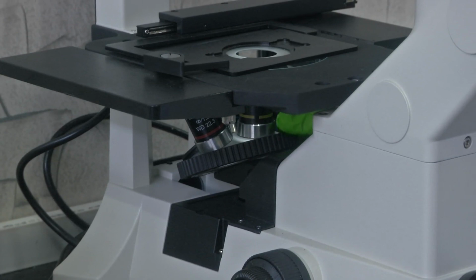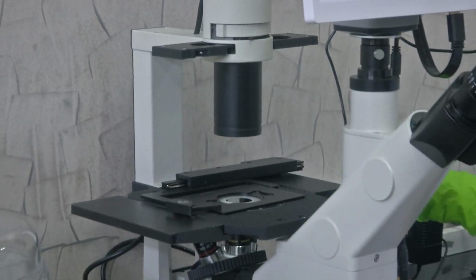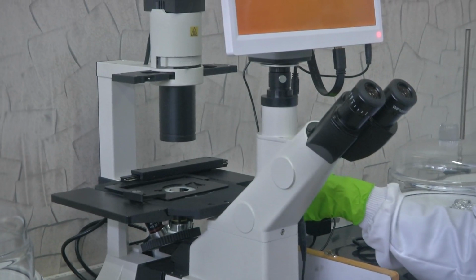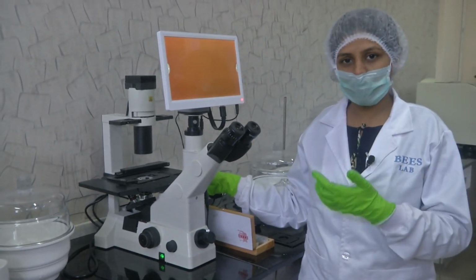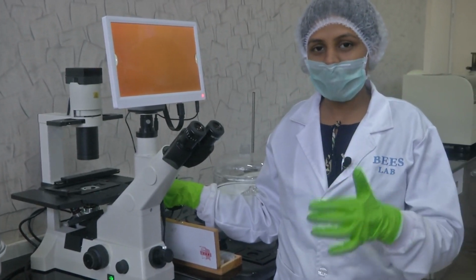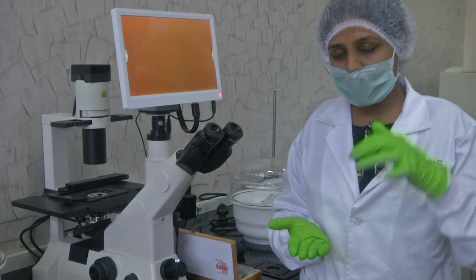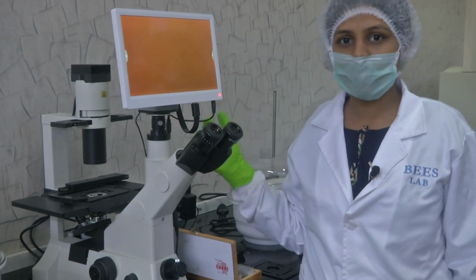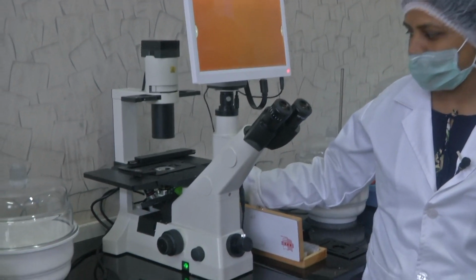Why do we have this placed in an inverted position or placed below, and the light source and camera at the top? I already mentioned the significance in the beginning of this lecture that when we are viewing biological samples, a cultured cell or tissue sample, the cells always have a tendency to settle at the bottom, and on the top is the turbid medium, that is the phosphate buffered solution, one such solution for culturing. This creates a turbid medium for us to view, because the cells are at the bottom. It becomes very difficult for light to penetrate, and capturing the reflected image would not give us the right features. So, this is how the turret has been located in the case of an inverted microscope.